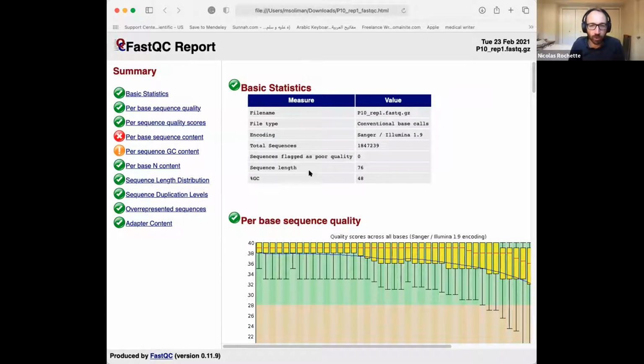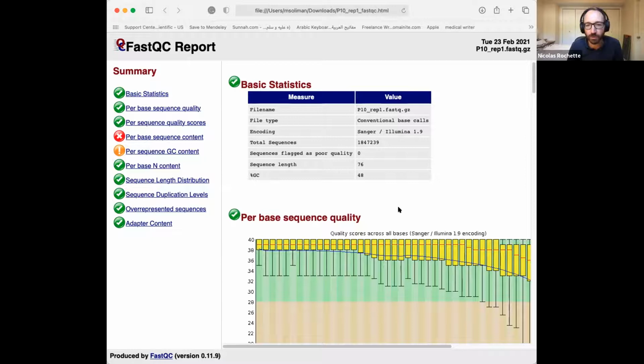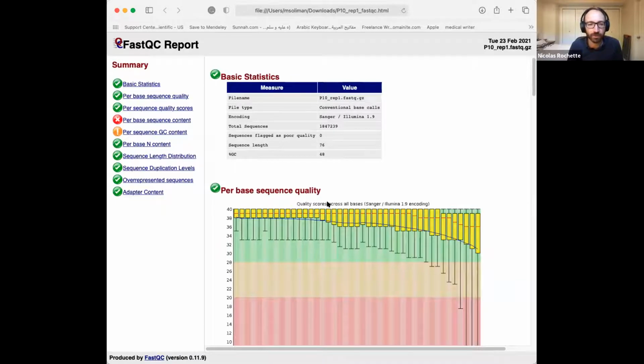By the Sanger/Illumina 1.9 encoding, they actually mean Phred33. At some point, the Sanger tradition had been to use Phred33, starting at character 33 in the ASCII table. And then the early Illumina machines started using 64, I think, changing the offset. And then they realized that it was a dumb thing to do, and that it was better if everyone used the same one. So they went back to Phred33, and now, except for very old data, you don't really have to think about other issues. It's always Phred33, but that's why it's called Sanger/Illumina 1.9.